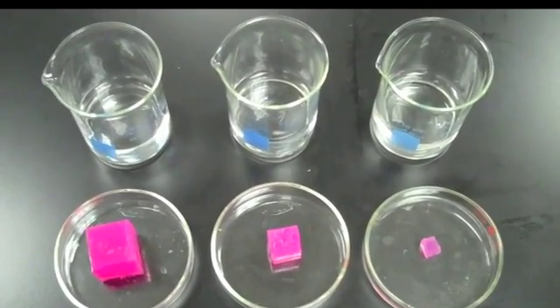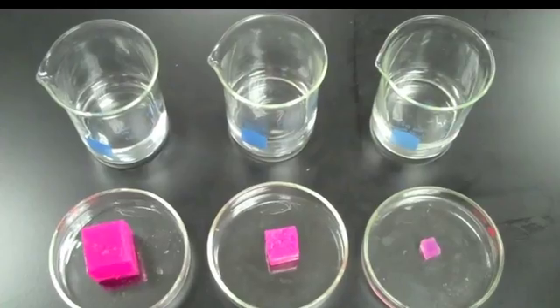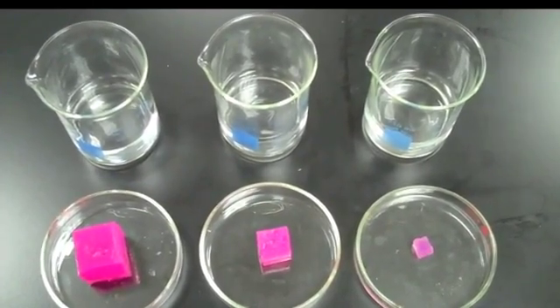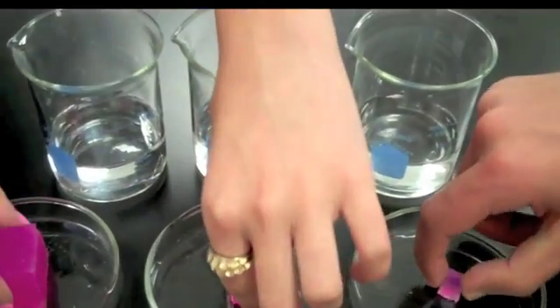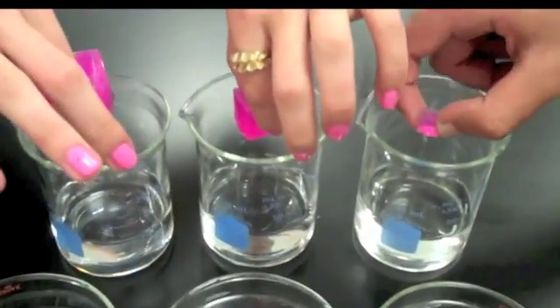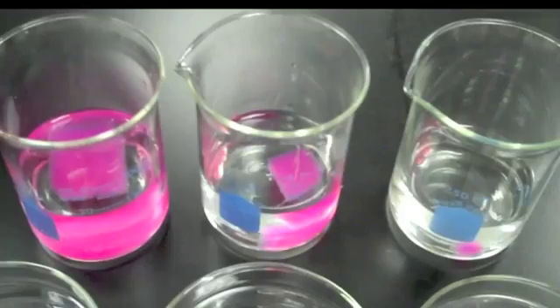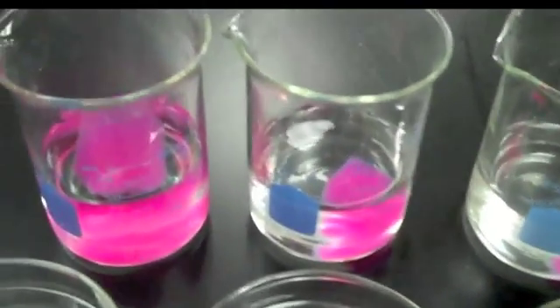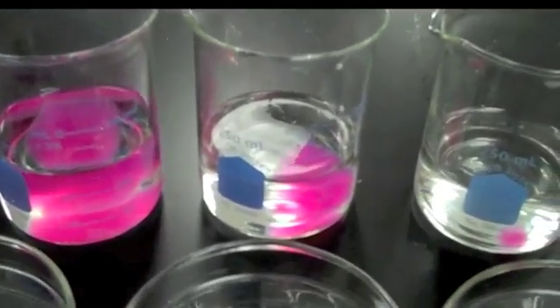Exchange of materials across the cell membrane often occurs through the process of diffusion, where dissolved molecules move from areas of high concentration to areas of low concentration. When the cubes are placed in the hydrochloric acid, the acid representing the raw materials will diffuse into the cubes turning the indicator clear. Let's see how this rate of diffusion varies.